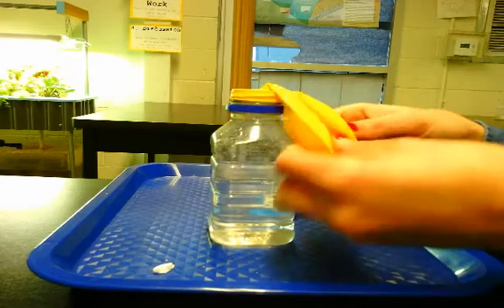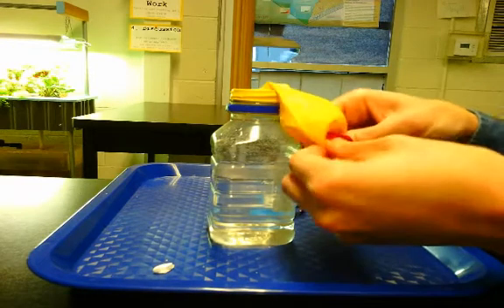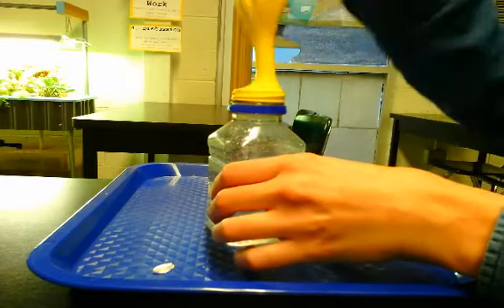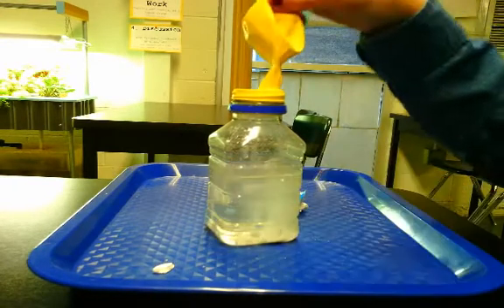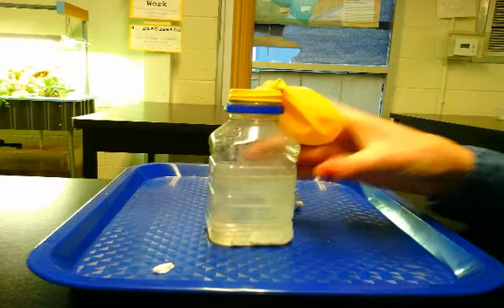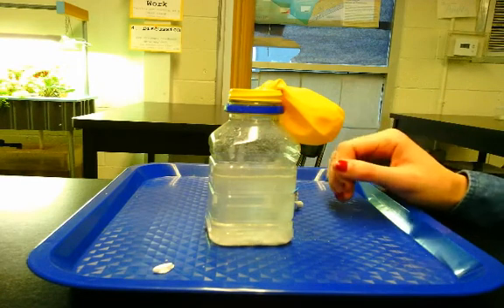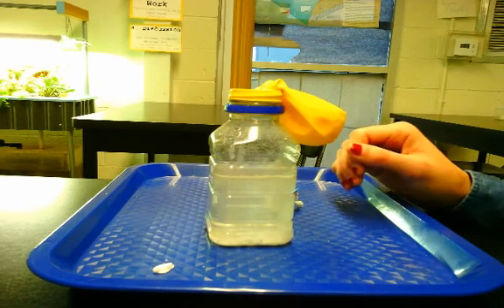In the balloon, I want to break up the Alka-Seltzer tablet just a little bit so it will fall into the water more easily. Once I'm ready, I lift it up and we let the reaction happen. After about a minute or two minutes when we think it's all done, we'll take the whole system back over to the scale so we can measure the mass after the reaction.